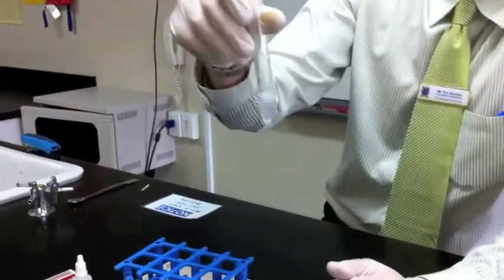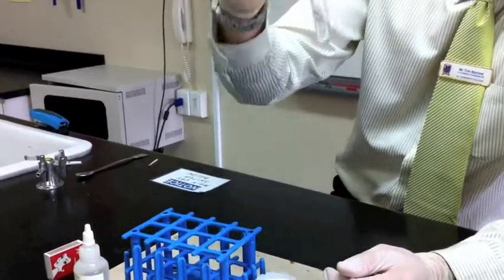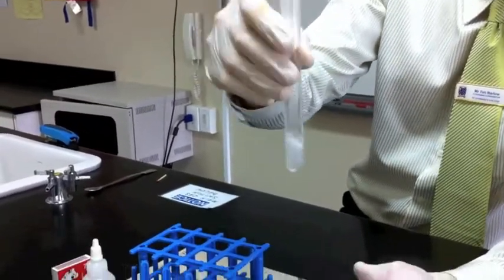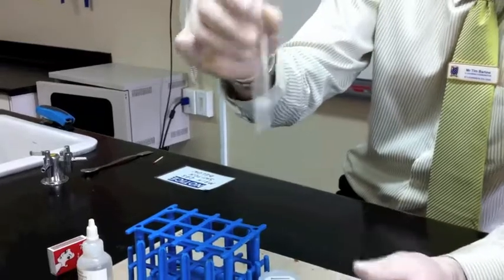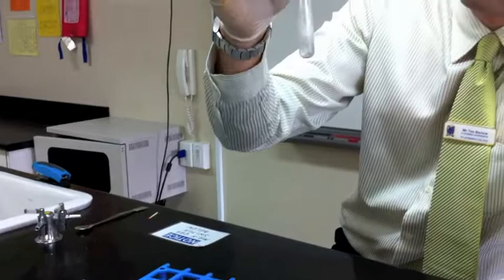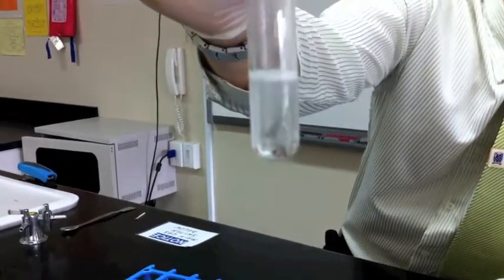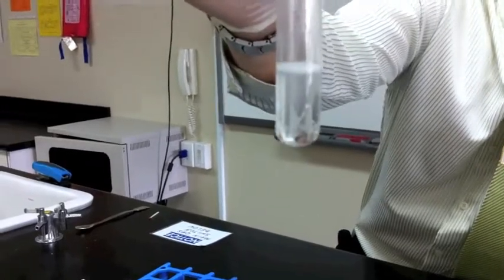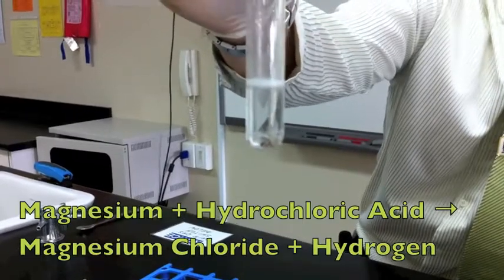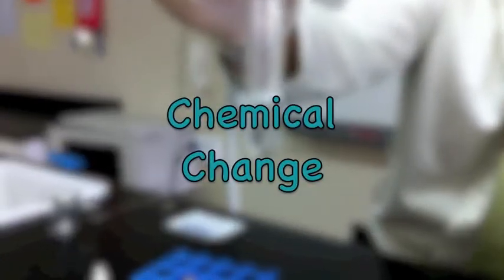But what happened then was, so we had magnesium ribbon, we reacted that with hydrochloric acid to form magnesium chloride and hydrogen gas, and then in fact we burnt the hydrogen gas in the oxygen in the air to form water. If we look closely at this test tube, you can kind of see that the magnesium ribbon is just about gone. It's just about all dissolved in that hydrochloric acid. So that magnesium ribbon and hydrochloric acid making magnesium chloride and hydrogen gas is a great example of a chemical change.